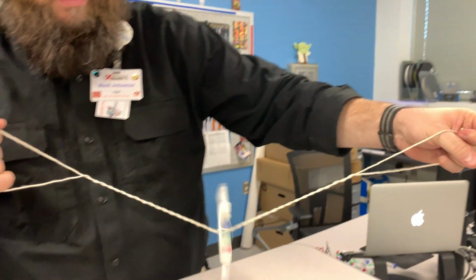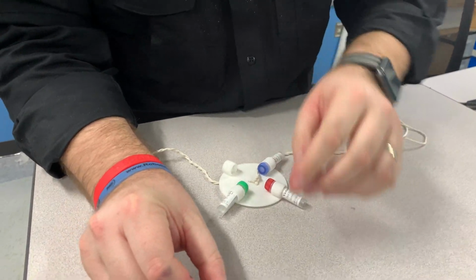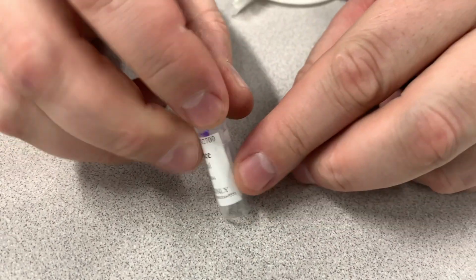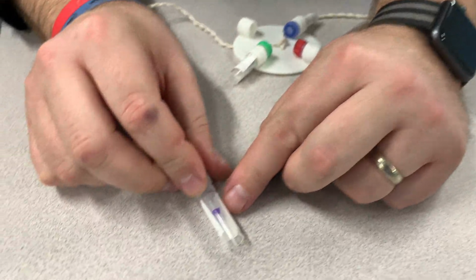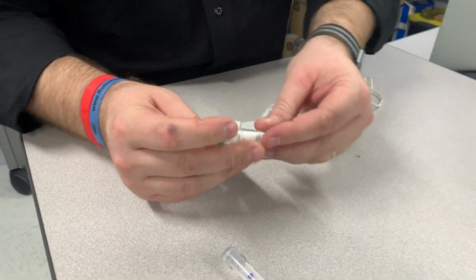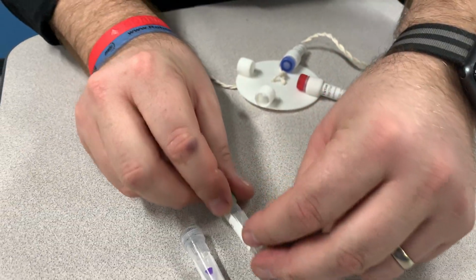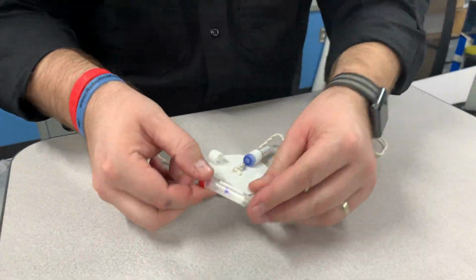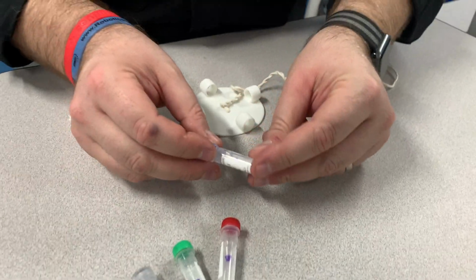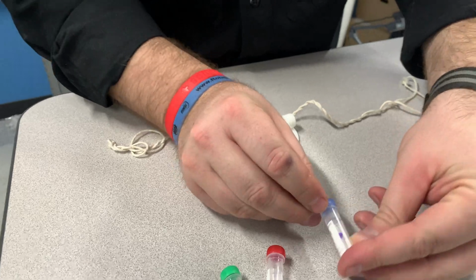Okay, now we should be able to see, yep, all the little DNA is at the end. And if it's got a little bit there, you just kind of tap it down, and then there you go. Same one. Let's check all 4 of them. Yep, same thing here. And that last little thing when it hit the table, that's really what kind of jostled it. But it keeps them all in big little globs. That's funny, right? In globs. So there you go. So there it is.